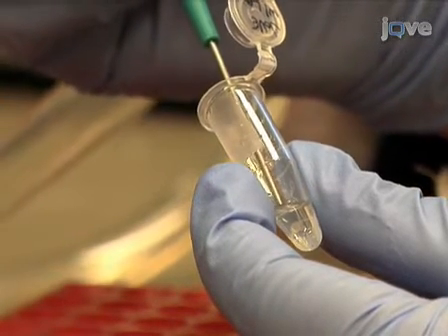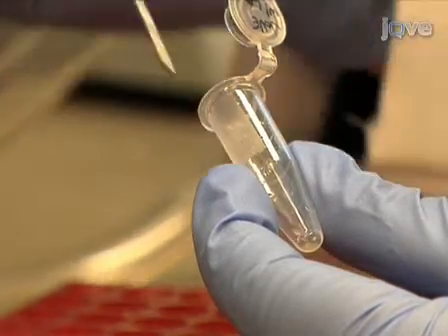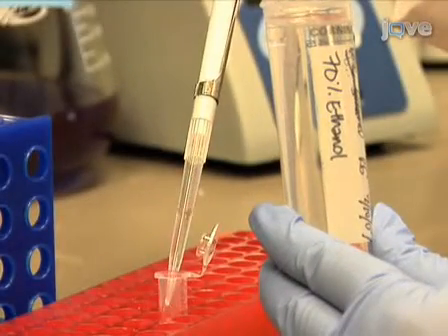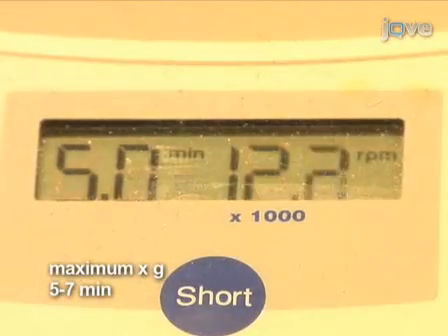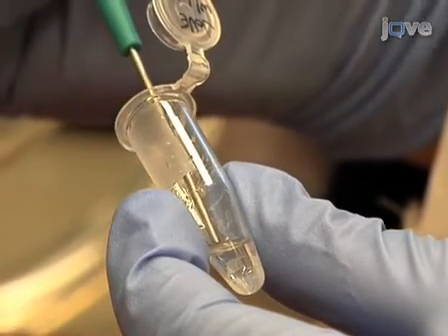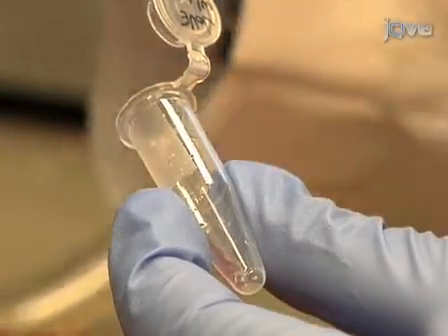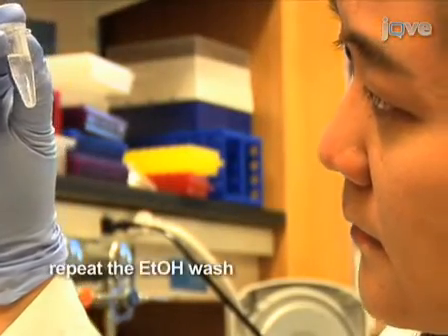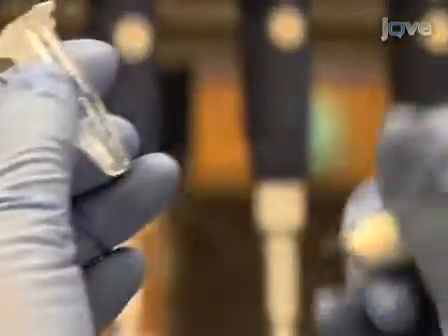Very carefully remove the supernatant from the tube, either with a vacuum aspirator or manually by pipetter. Do not disturb the pellet. Wash the pellet with 1 milliliter of 70% ethanol and centrifuge at top speed for 5 to 7 minutes. Very carefully, remove the ethanol from the tube either with a vacuum aspirator or manually by pipetter. Discard the supernatant. Check that the pellet is visible at the bottom of the tube. Repeat this wash step. After the supernatant is discarded, mark where the pellet is on the tube.